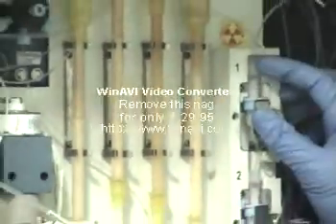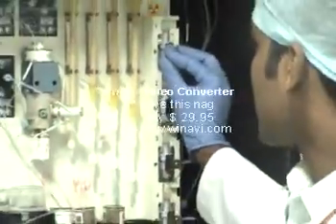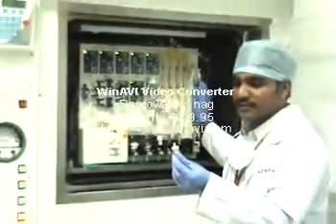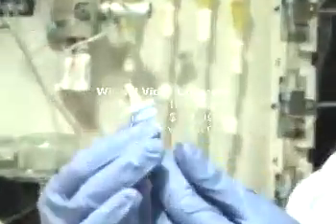What you are seeing here is called QMA — we can call it the hero of the synthesis. Because whatever activity is produced, whether it may be 5 curie or 6 curie, it all gets collected in the QMA. QMA is basically quaternary methyl ammonium resin. This here is the QMA.